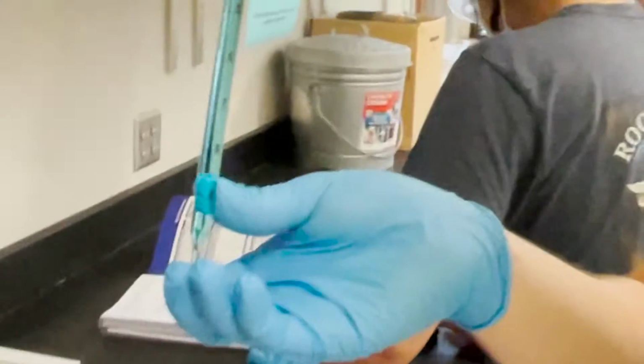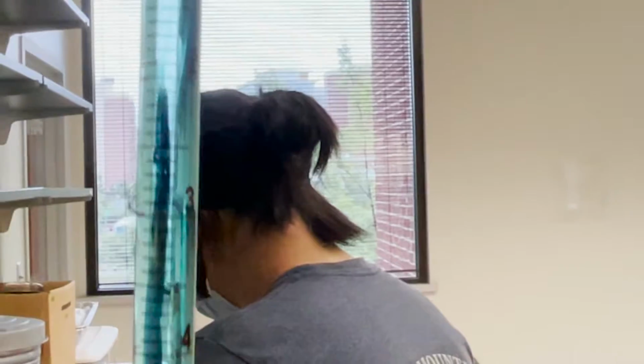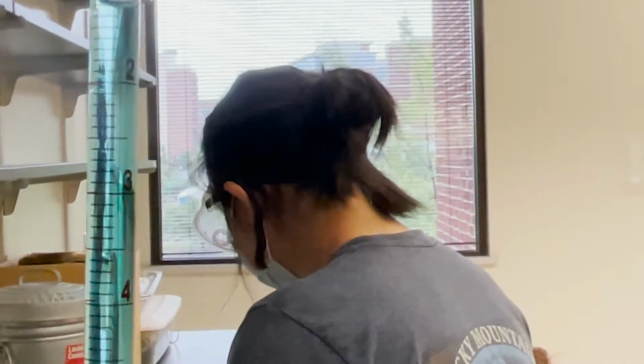Before beginning this experiment, we must understand the terms we will be using in this video. The first being meniscus. When water is placed in a piece of glassware, the water molecules that are in contact with the glassware begin to crawl up the edge of the container. This forms a curve that is called the meniscus. When reading a measurement of liquid, in this case water, in a container, the number we read is at the bottom of the meniscus.